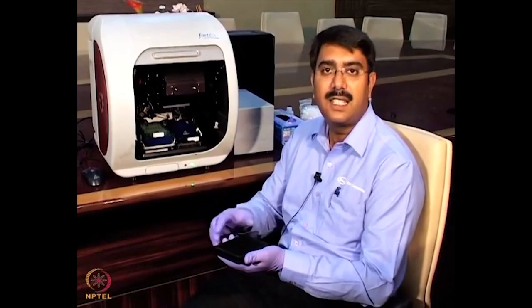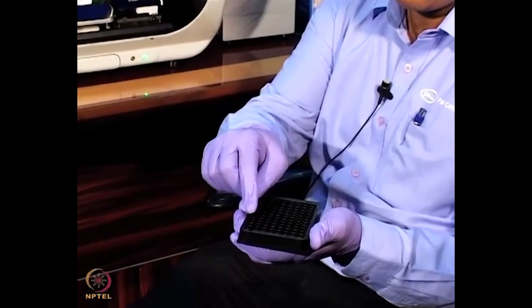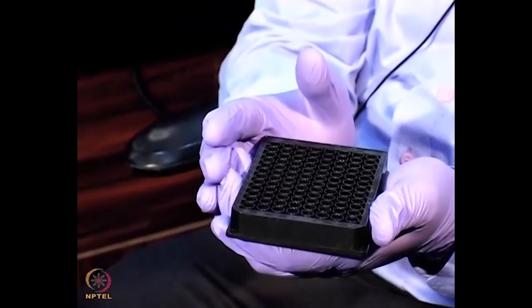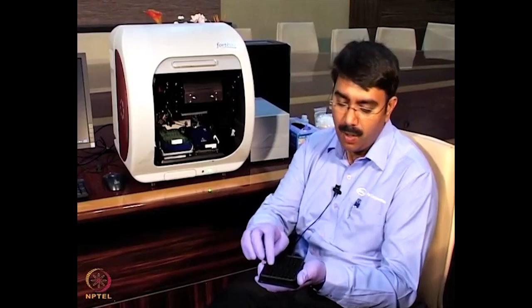I am going to demonstrate the kinetic interaction of the mouse monoclonal antibody to the protein A ligand. I am using biotinylated protein A as a ligand at a concentration of 10 µg/ml, placed into 6 wells. The mouse monoclonal antibody is used as the analyte, starting at 25 µg/ml. I will perform a two-fold serial dilution from 25 to 12.5 µg/ml, continuing serially for around 6 data points. This is the plate map — buffer in column one, biotinylated protein A in column two, buffer in column three for washing unbound protein A, and the analyte in the last wells.